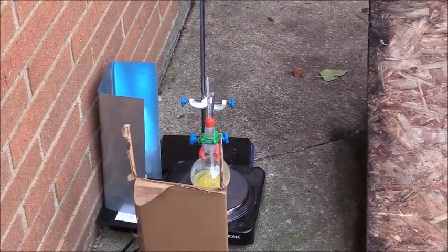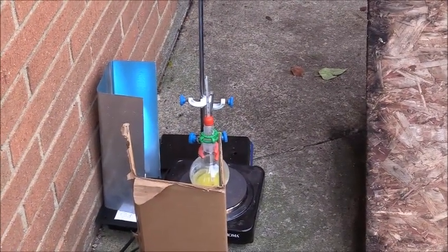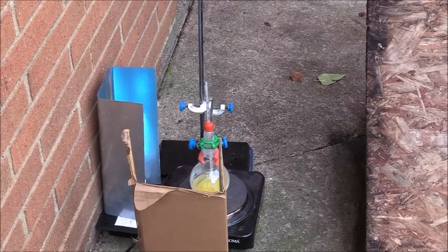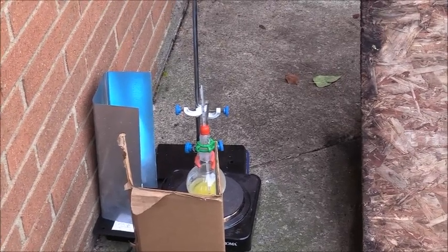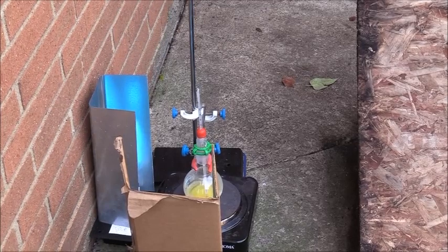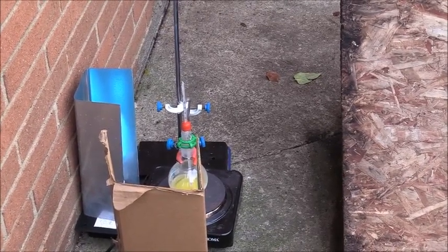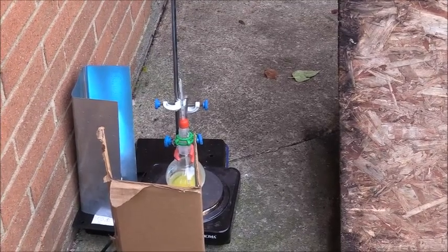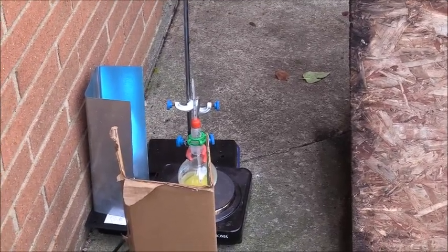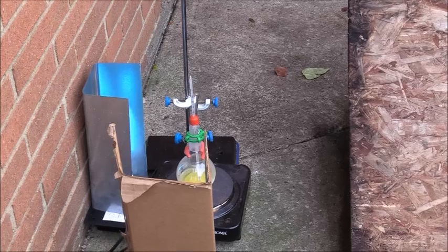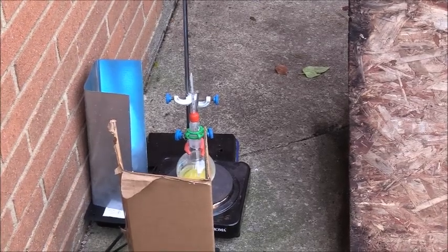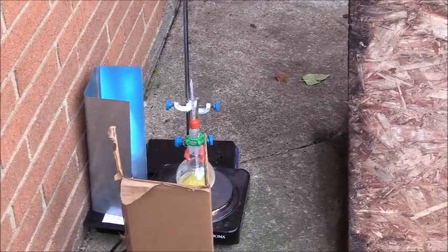So it's been 24 hours since the beginning of this experiment. The solution of formamide, the temperature has dropped a little bit. I had it at 150 Celsius. It's now between 140 and 150, but that should be sufficient. So we'll just keep heating it and we'll see what happens tomorrow.